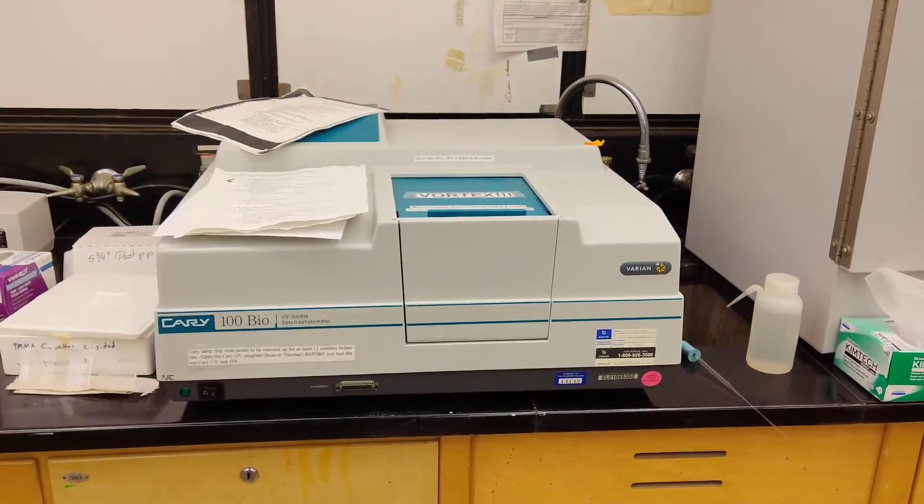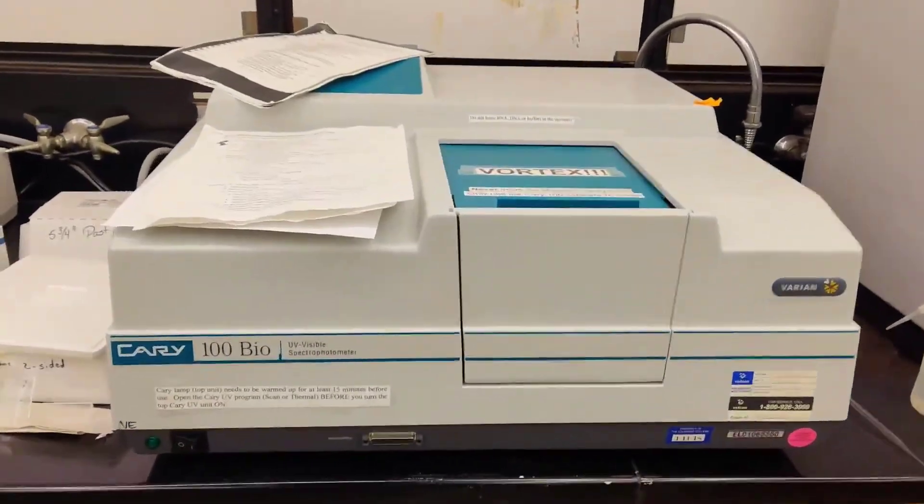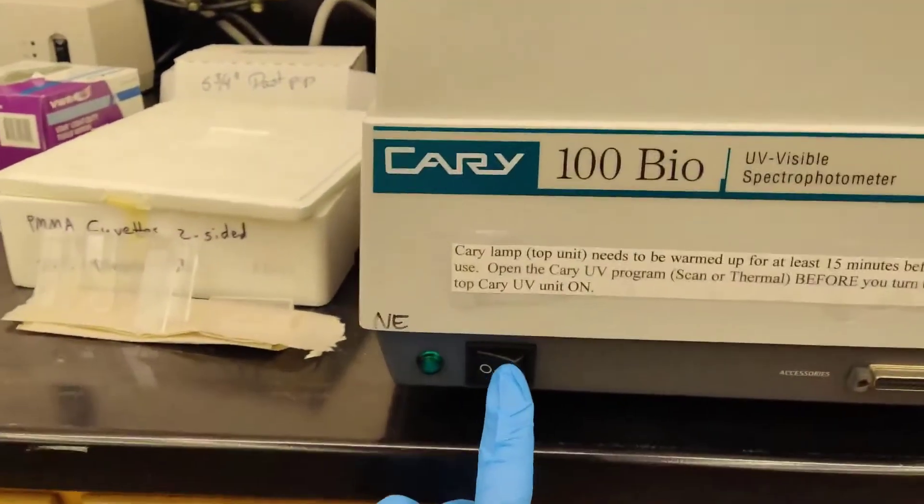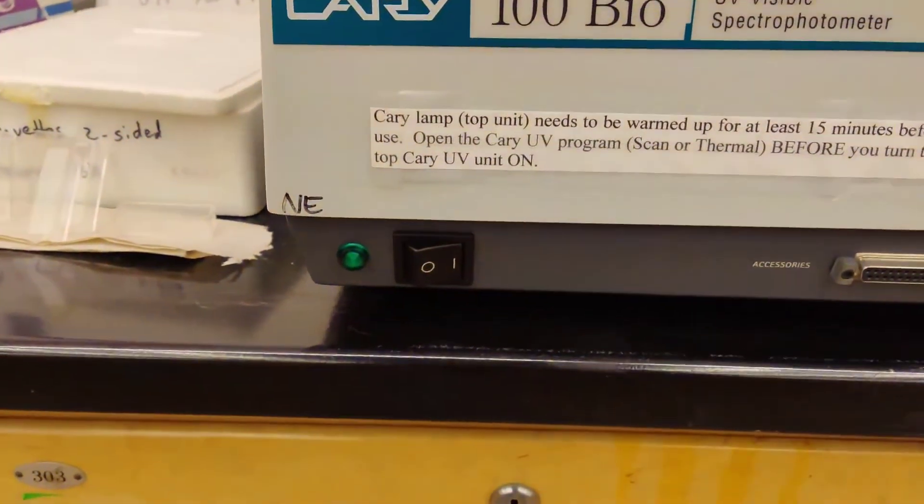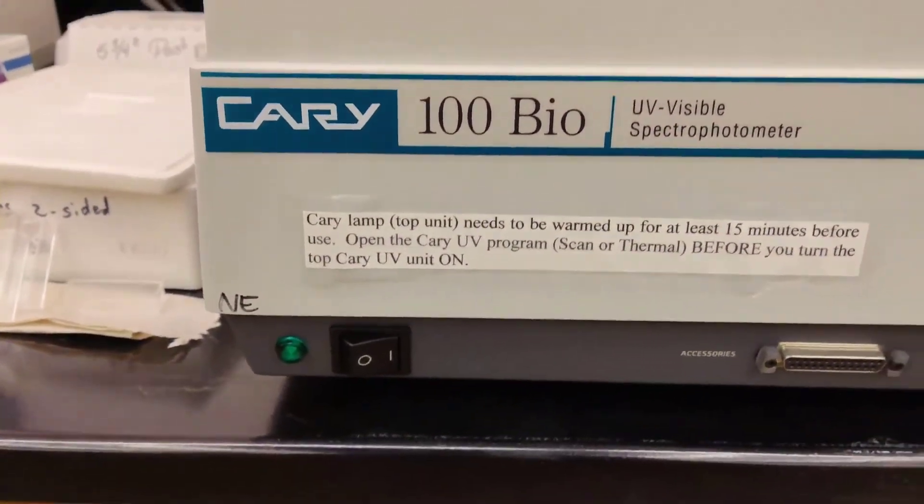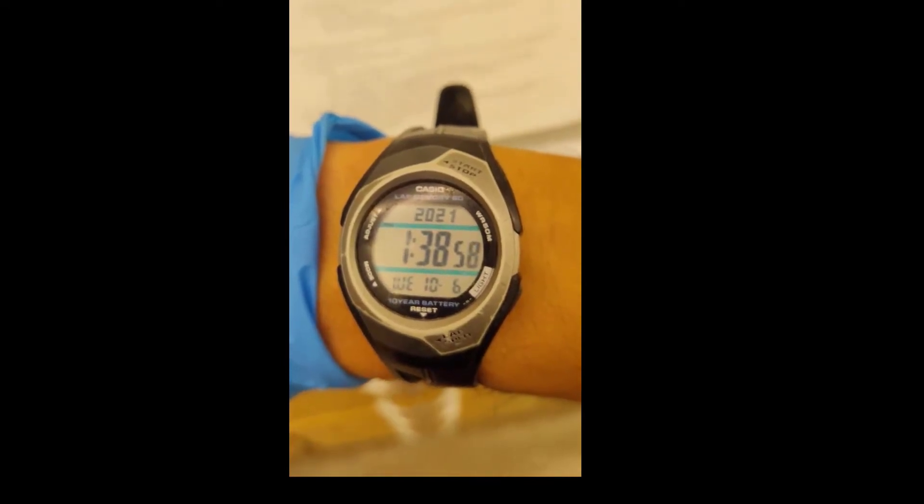So this is what the instrument looks like. The very first thing you want to do is turn it on. Just flip the switch right there and you want to let this thing warm up for at least 20 minutes. So just keep track of the time.